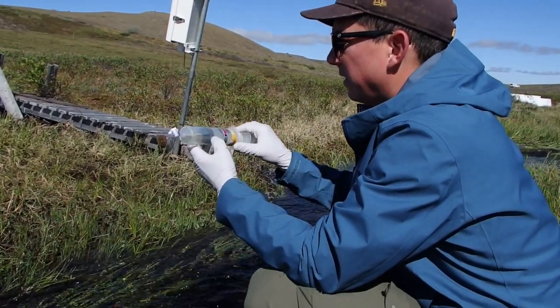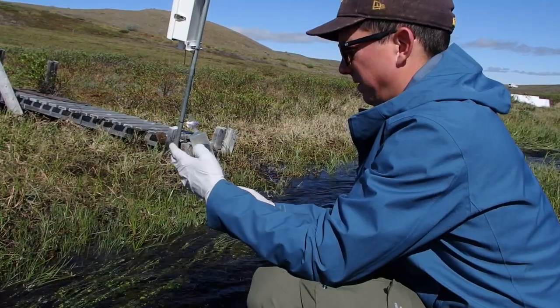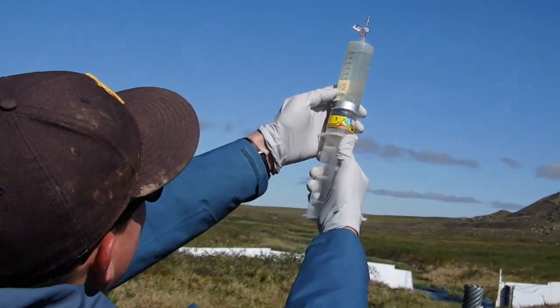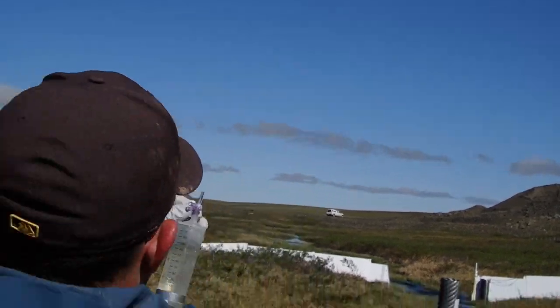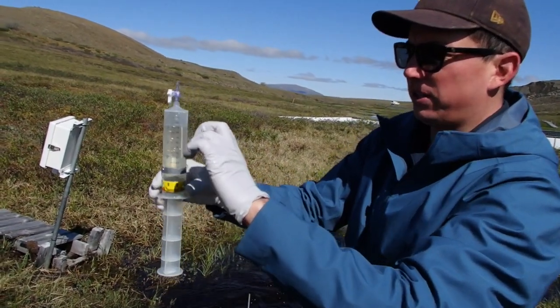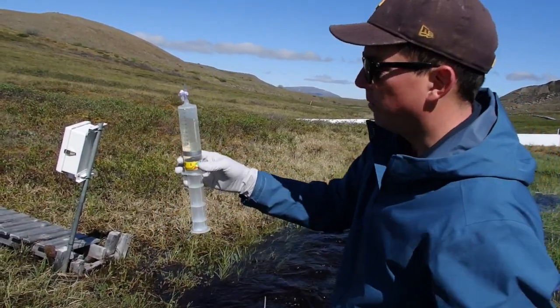He's making sure that this water sample is bubble free. He grabs some gas to create a headspace of gas and a water sample, and wants to shake and equilibrate these two fractions in the stream where he collected.